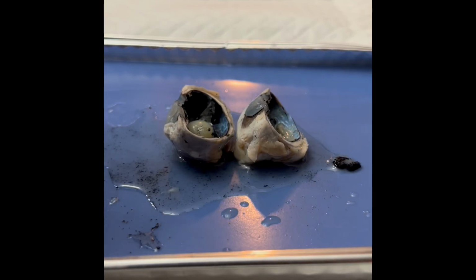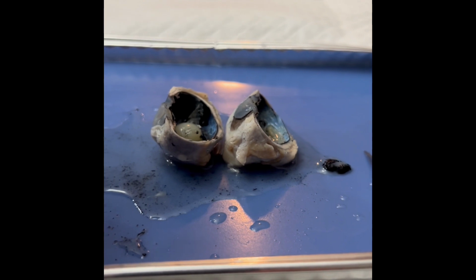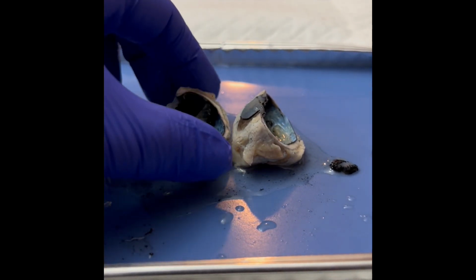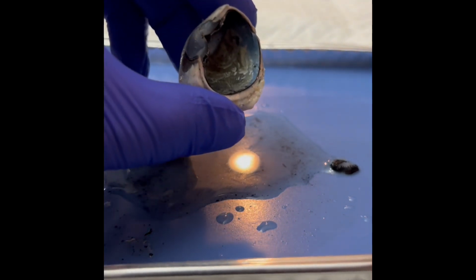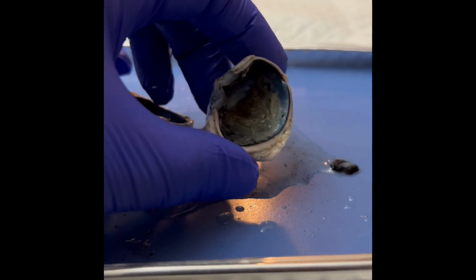I'm going to be going over some of the structures of the eye in the final lab of the semester, the dissection of the cow eye. As you can see here, other than my list, I have no other supplementary information to help me with this lab. So let's get started. I dissected the eye. I think it's a little easier to see some of the structures, even the exterior structures, when it's dissected.